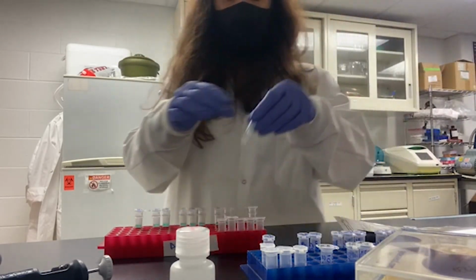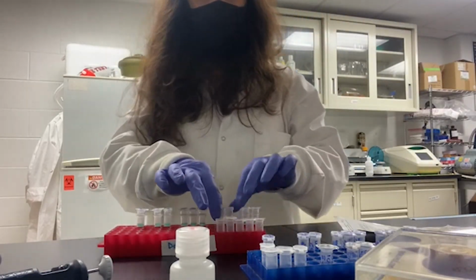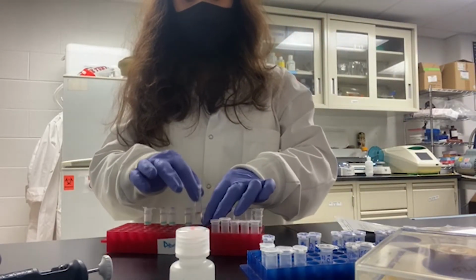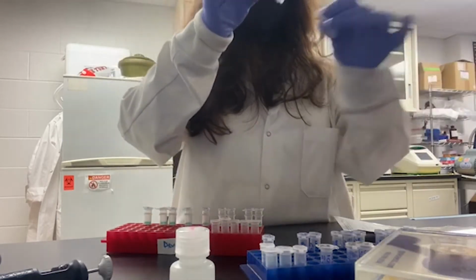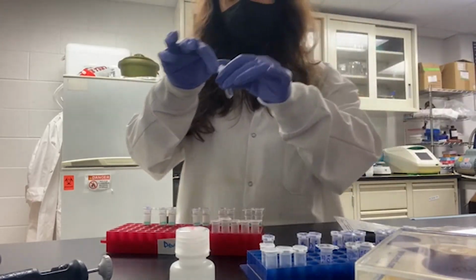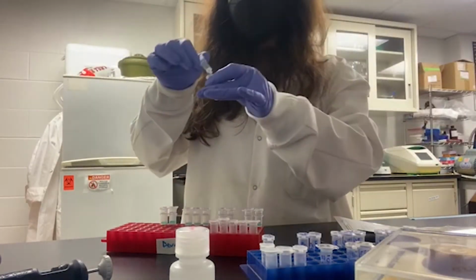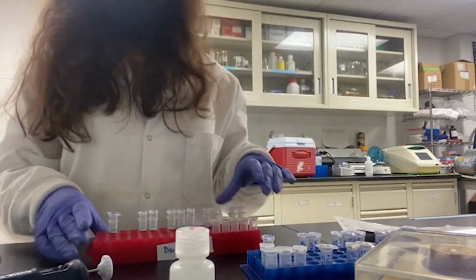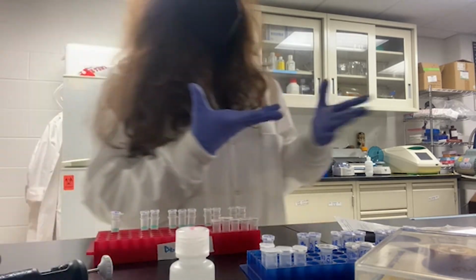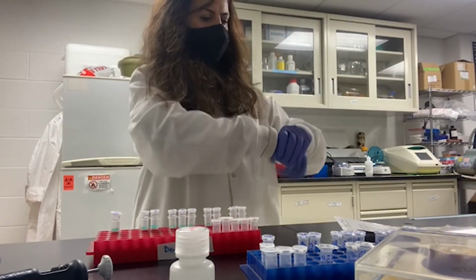Now the next step is washing the RNA, and it's a reagent with ethanol. It's pre-prepared by Zymo, so it's going to clean up the RNA in the column and make it ready so we can elute it with the RNase free water. It's removing all the inhibitors, salts, humic acids, so it's cleaning up our RNA. Whenever I feel like my gloves are not clean enough, I want to clean them with ethanol.